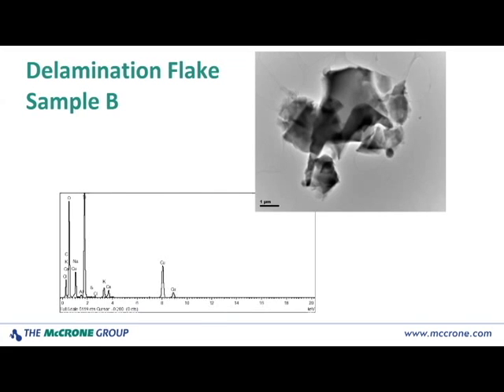In the case of sample B, again, delamination was not seen in the SEM, but in the TEM, I found evidence of smaller flakes or aggregates of small fragments, as you see in the image. This was out in the middle of the grid square. The grid squares are about 100 by 100 micrometers. So you can see that with the 1 micron scale bar, we have a small cluster of glass delamination fragments, a few micrometers in size, and again, plenty of areas for analysis and an EDS spectrum that is absolutely characteristic of glass delamination.